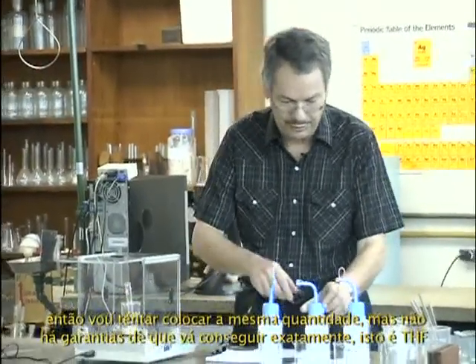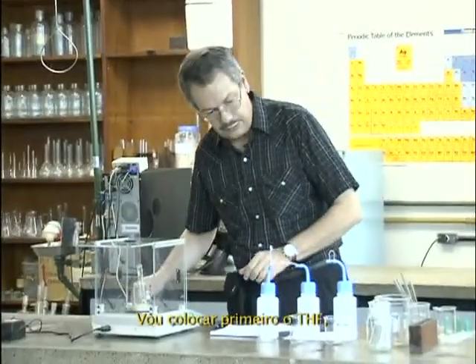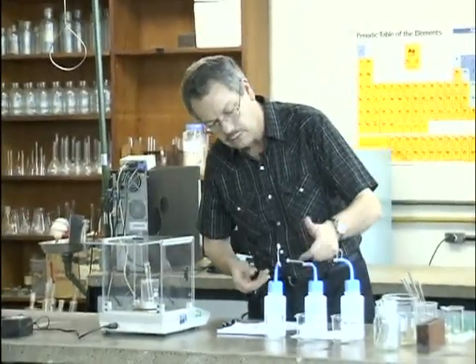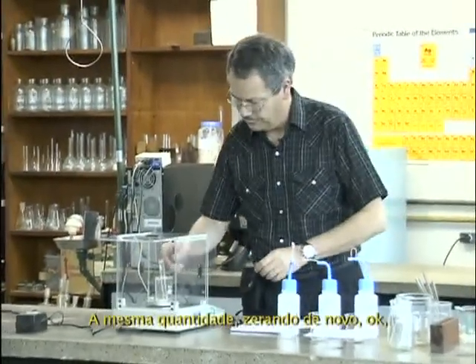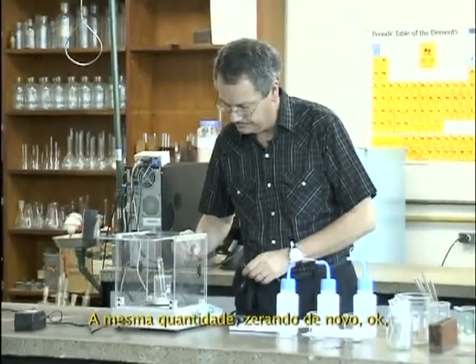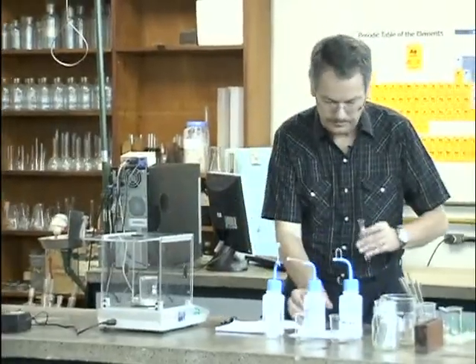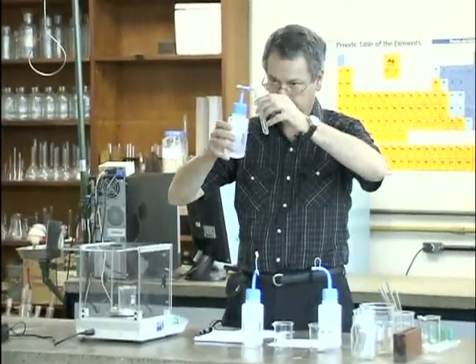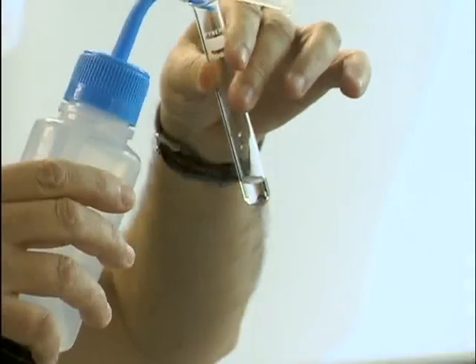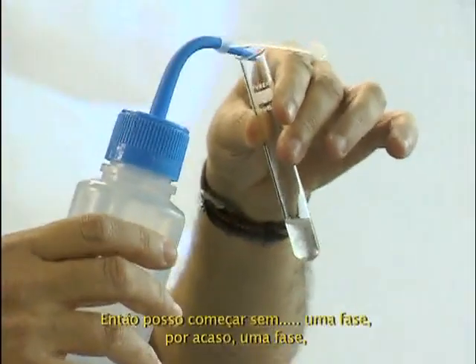So this is THF. I'll put THF first. It's dripping alone. First, the same amount, putting zero again. Okay. So I can start.